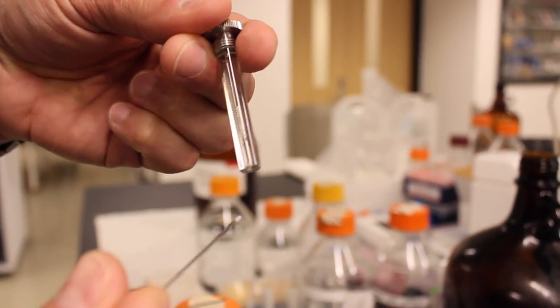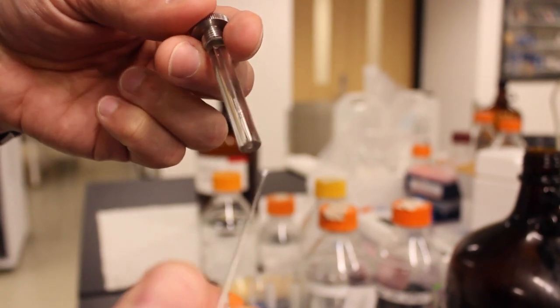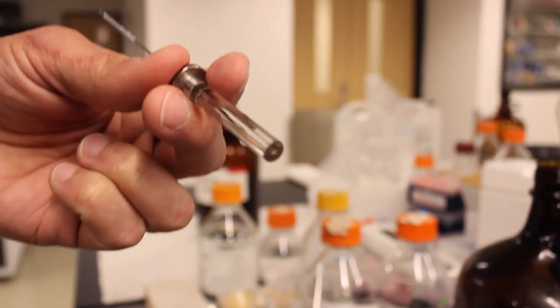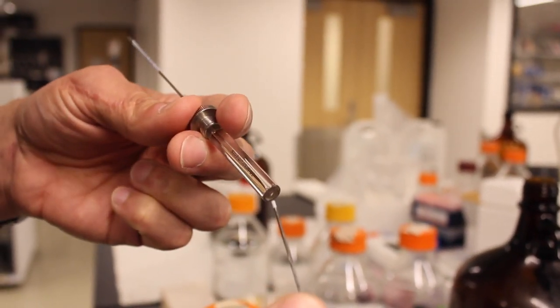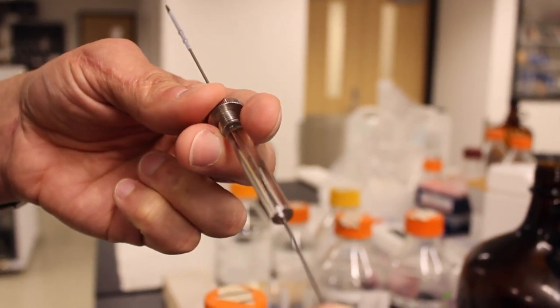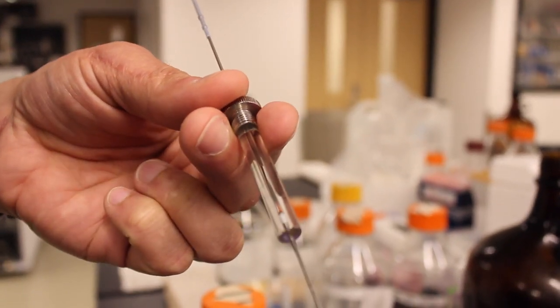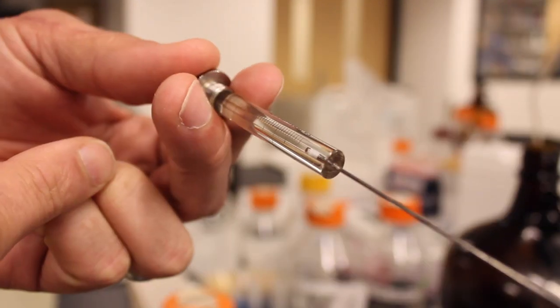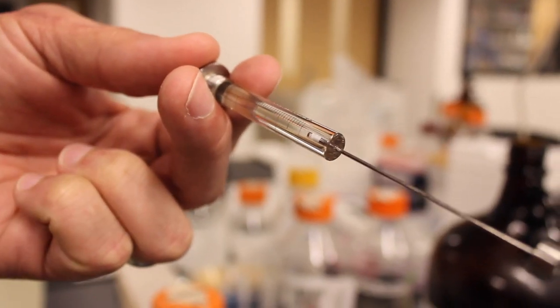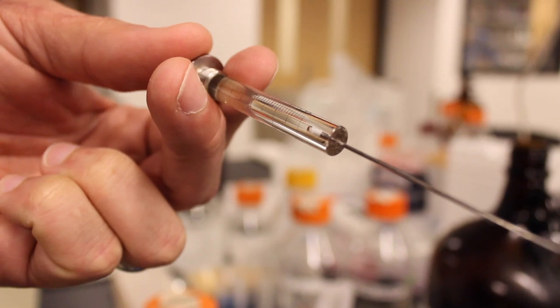the liquid to flow all the way down to the bottom. If it flows out typically surface tension will hold it in place and then you can tip it back and what you want is to insert the plunger of the syringe so that there's about a one to two millimeter gap between the top of the liquid and the tip of the plunger.